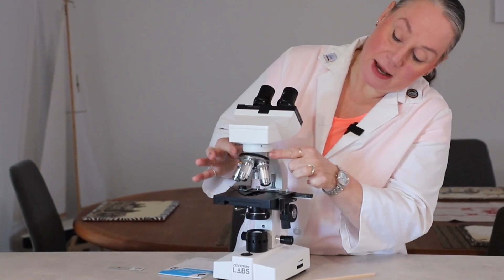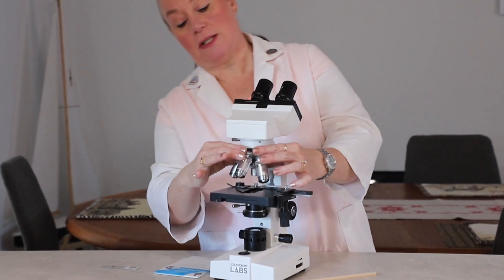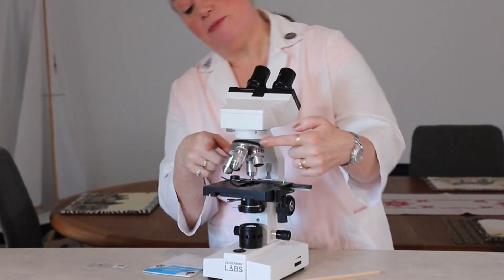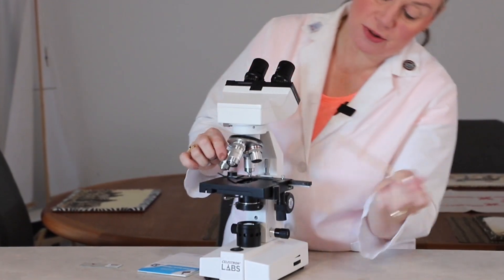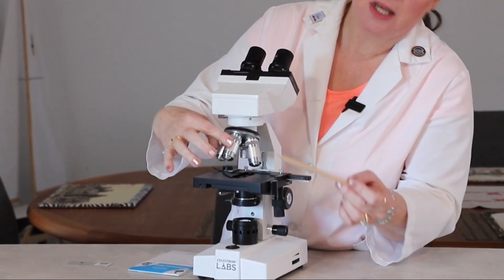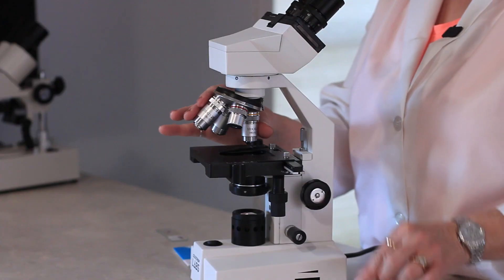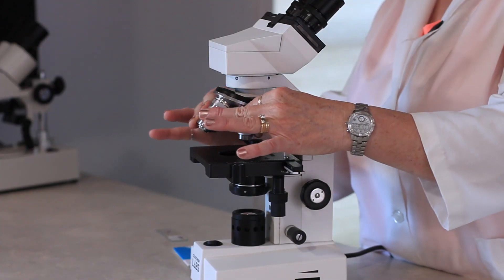We have our revolving nosepiece right here. This is the part that allows our objectives — which are each one of these different lenses — to be rotated as we are increasing magnification or decreasing magnification.